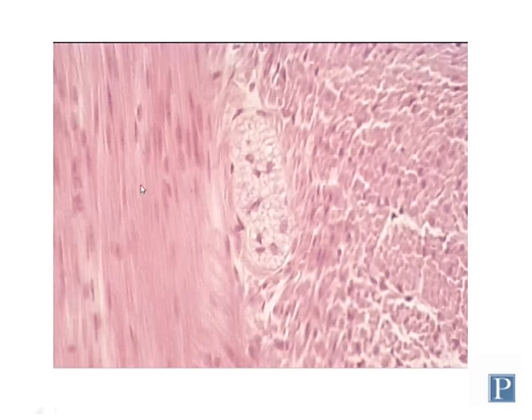Sheets of smooth muscle are often found in different types of layers. So in most of the alimentary tract or the gut, there's a thick wall of smooth muscle, and there are two different layers that are oriented perpendicular to each other. So here's another example of a parasympathetic ganglion surrounded by one layer of smooth muscle in cross-section.